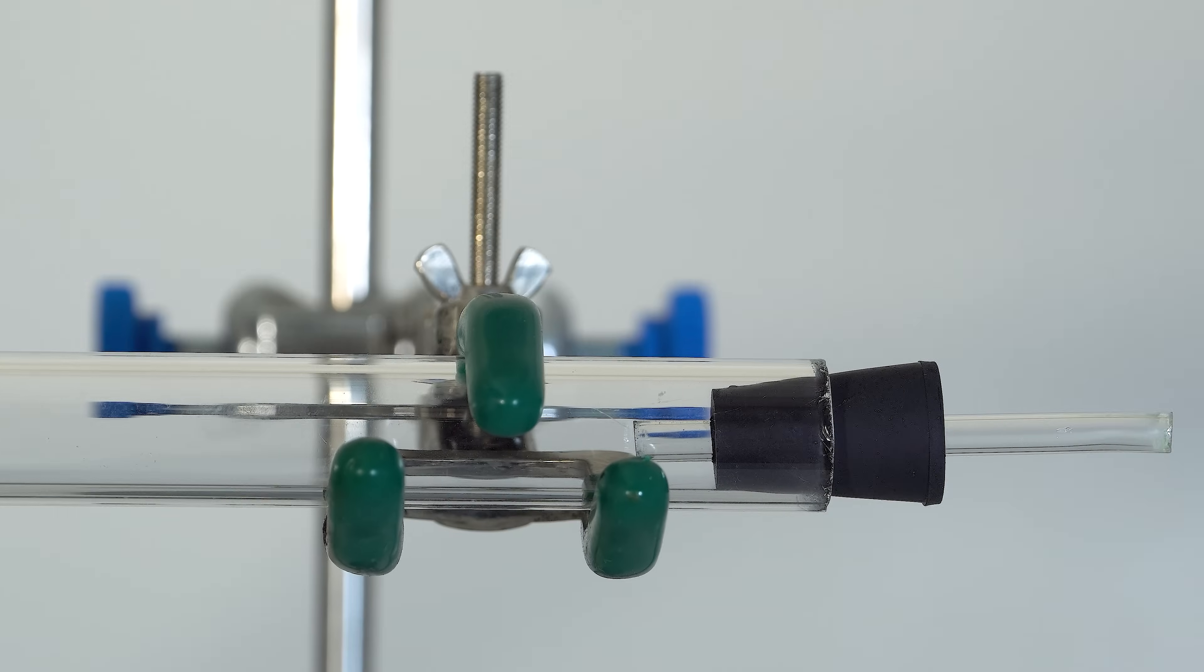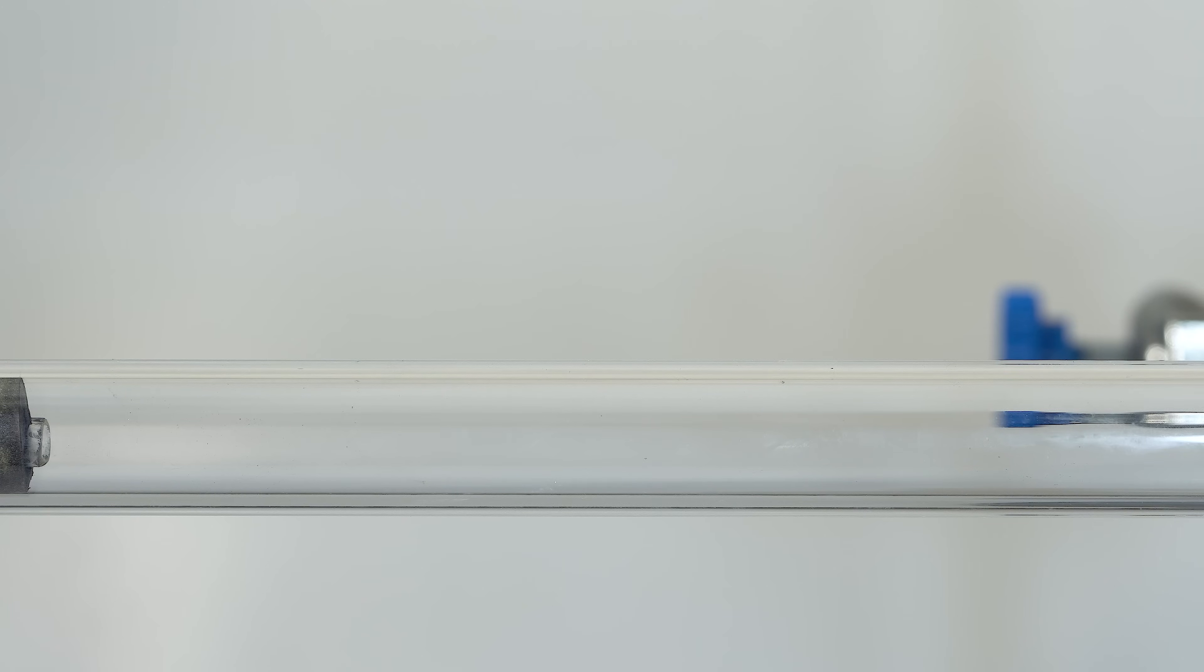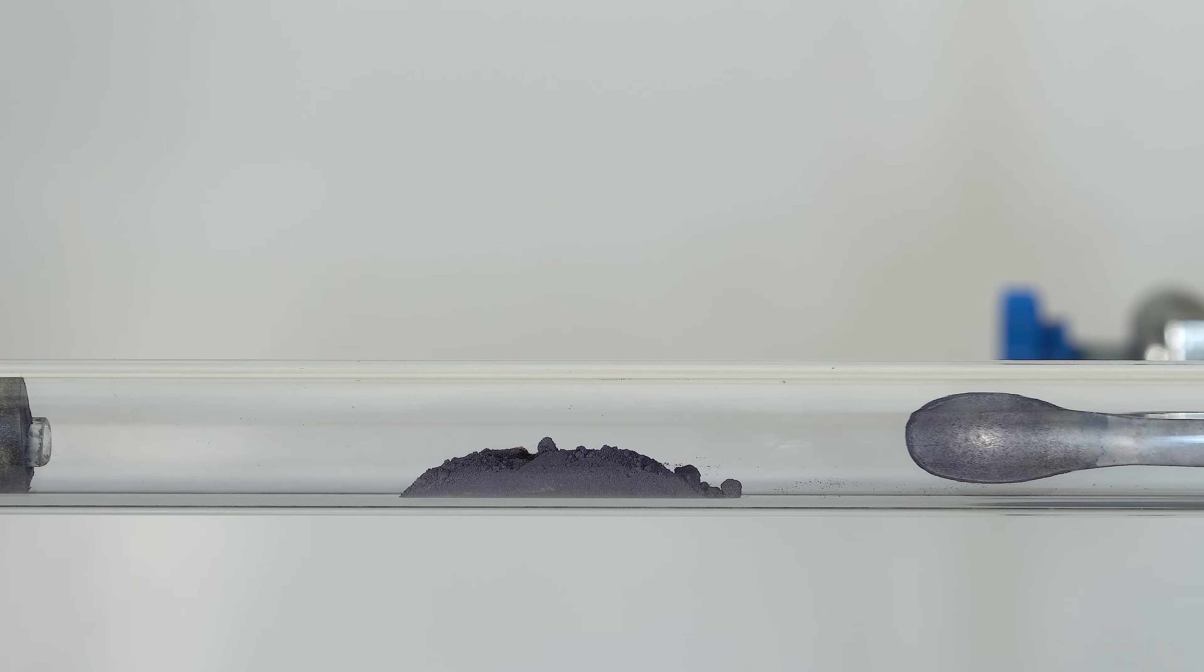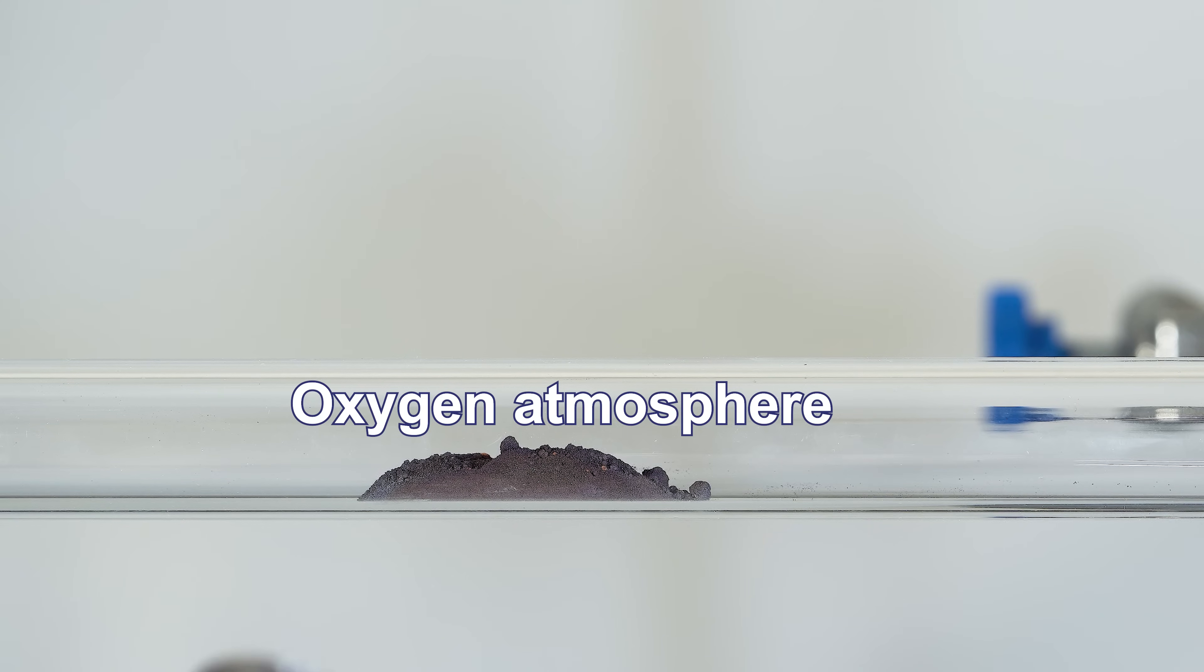But what happens if we heat tungsten hexachloride in an oxygen stream? The setup for our demonstration is the same as in the experiment with tungsten hexachloride. Only instead of an inert atmosphere, there will be an oxygen atmosphere.